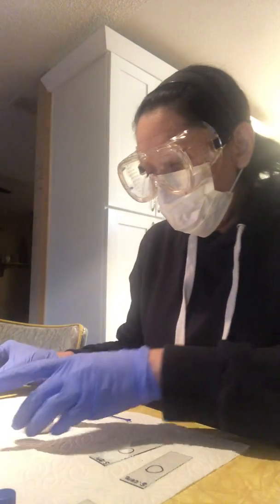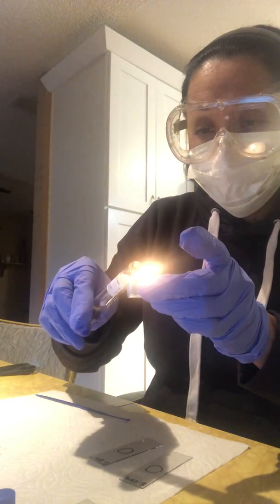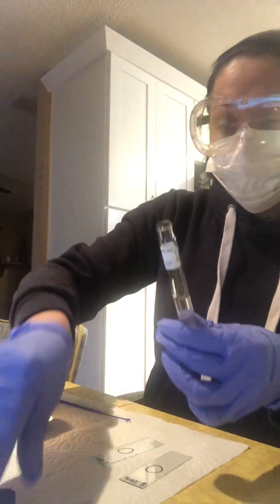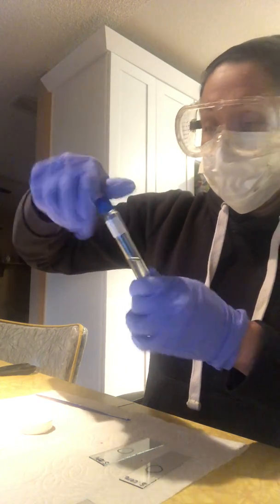Now I'm going to sterilize this again, and I'm going to place the cap on it.